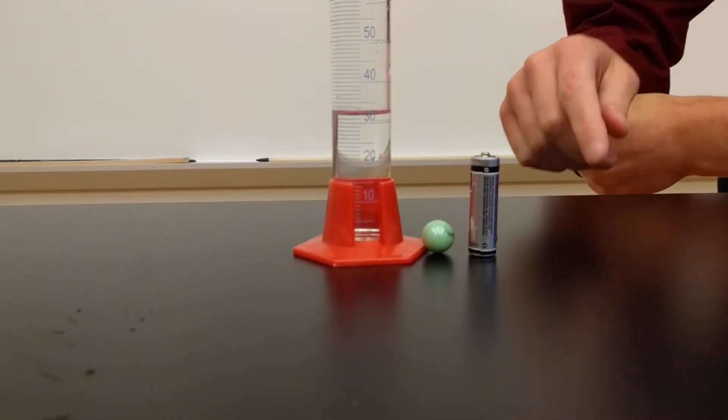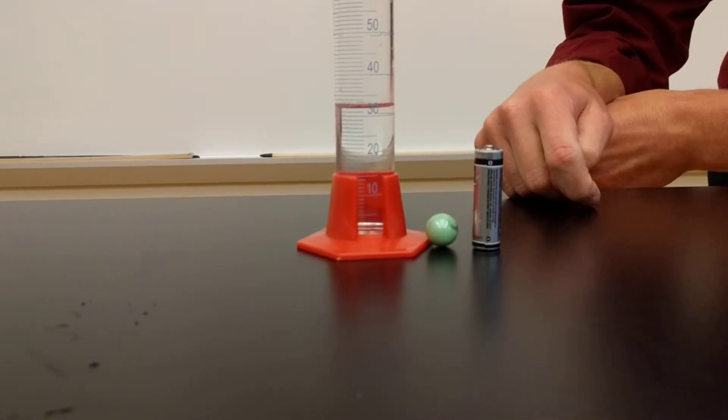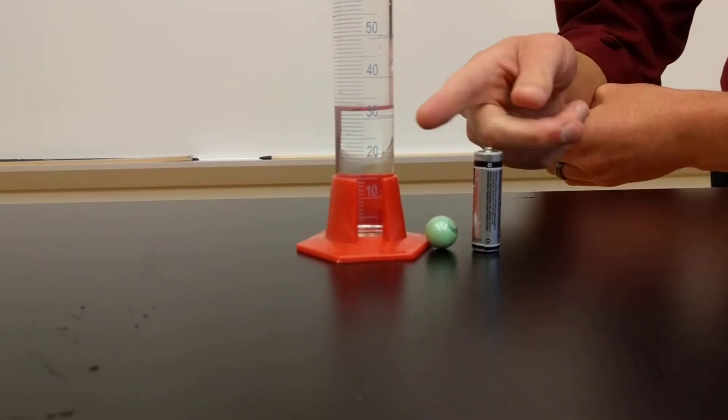So in this case, what we've done is we've added water, and we've added enough water that's going to cover both objects. And you can add as much as you want or as low as you want, as long as it covers both.